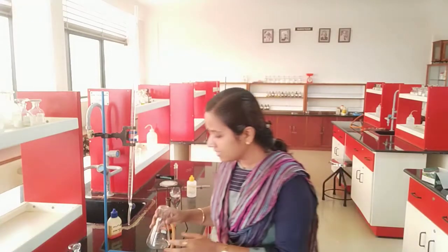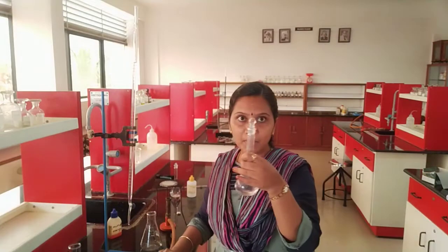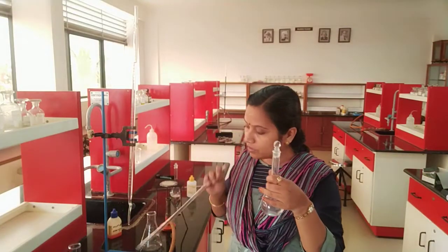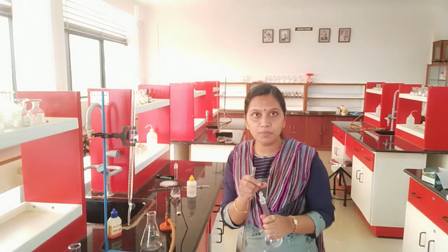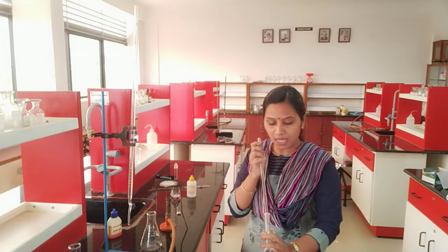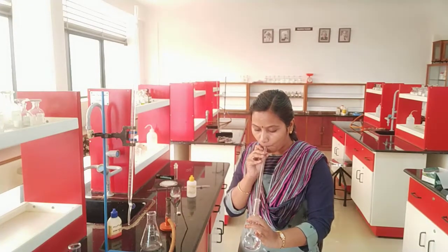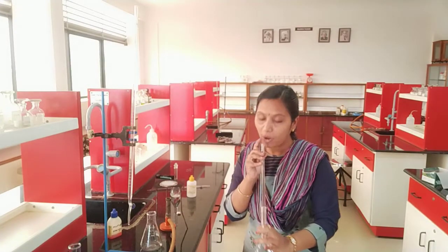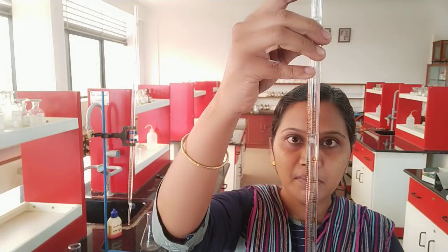I have taken my conical flask and I need to pour 10 ml of sodium carbonate. What acid is taken in the burette? HCl. And the base here is sodium carbonate. So 10 ml of sodium carbonate I am taking.